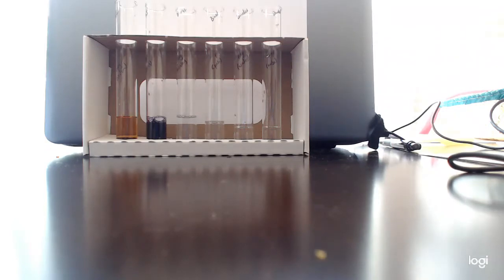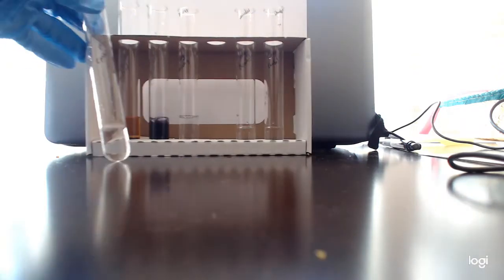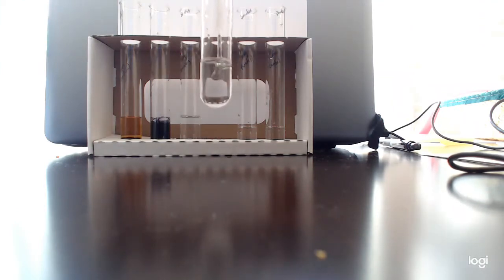And again, this is a colorimetric test, so we are expecting a color change in order to measure the presence of a protein. So, oh, gross, hang on. I made this special for you guys. This is our special protein positive control. It's kind of slimy and gross. Don't do this at home. Well, maybe watch the video at home. How about this?